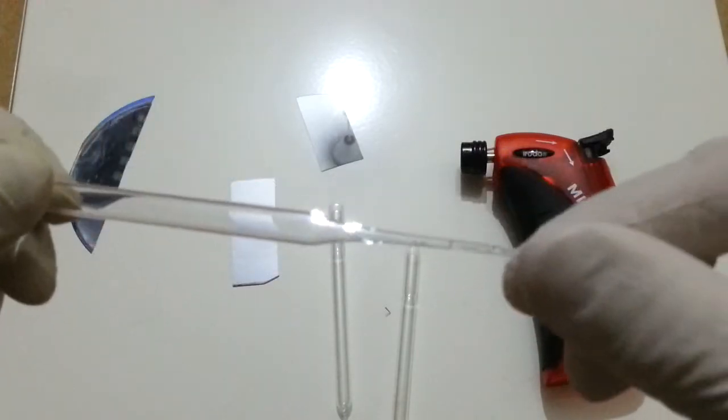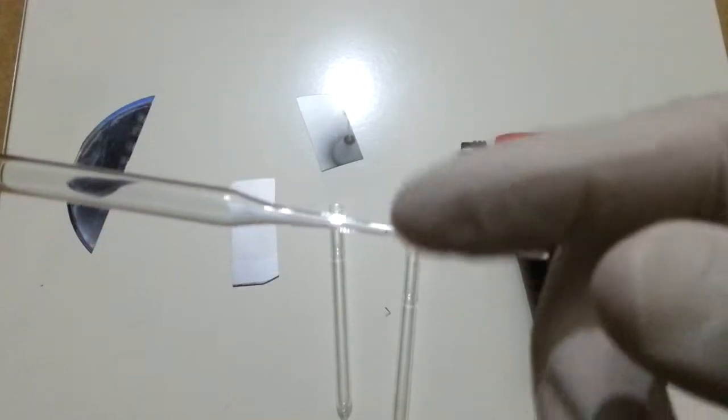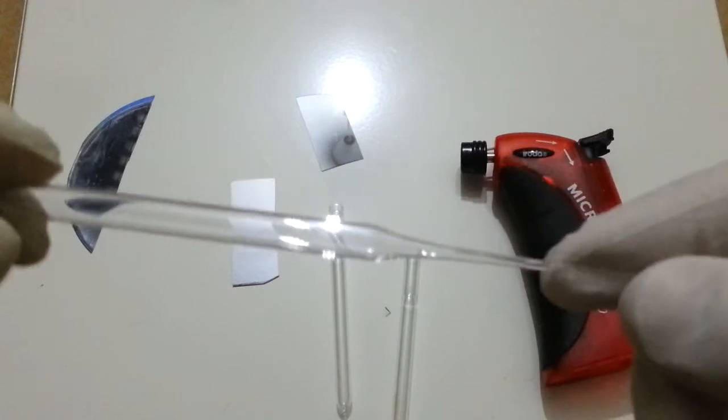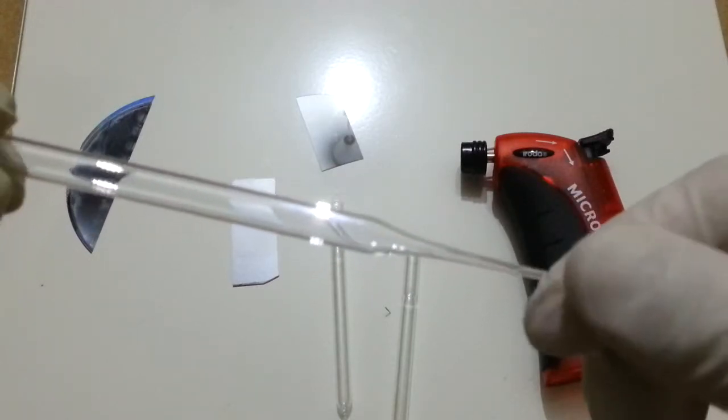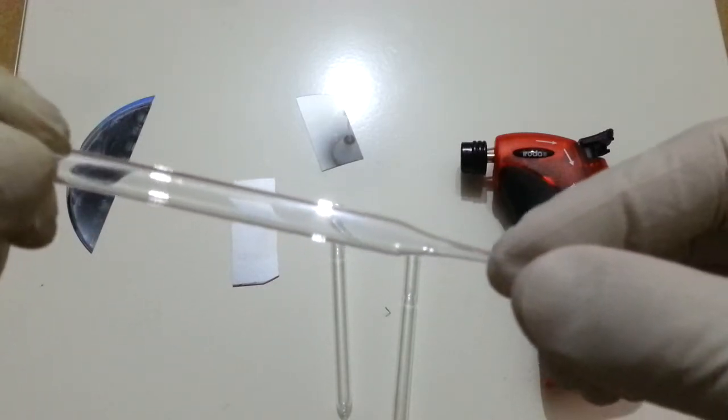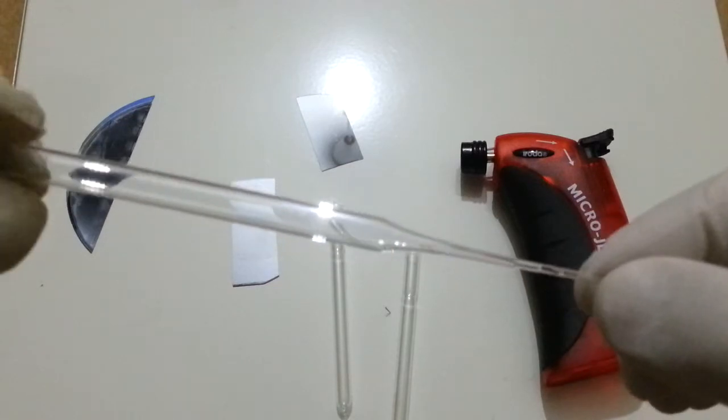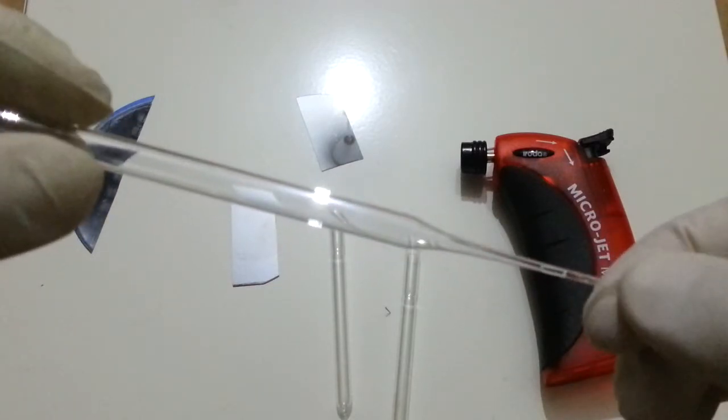This one still has some water in it. But even if you buy the Pasteur pipettes as new, they are going to cost next to nothing. You can buy a box of 150 for $12.